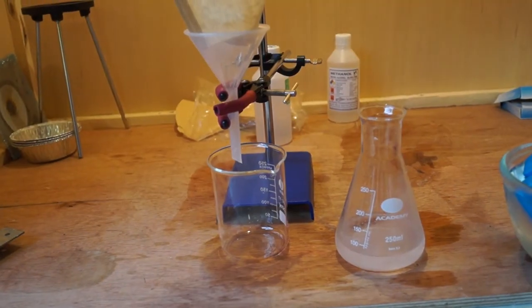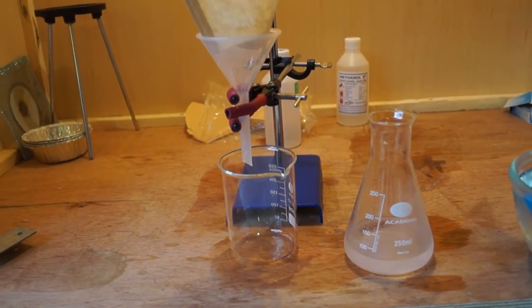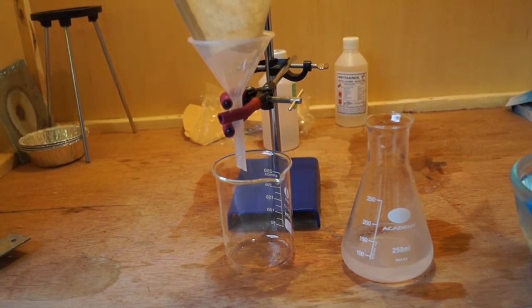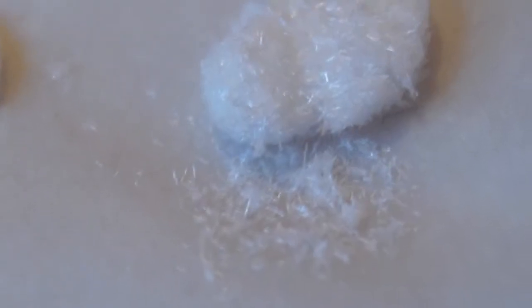When all of the aspirin has crystallised out of the solution, set up your filtration apparatus and filter the aspirin precipitate from the mixture. Leave the aspirin to dry.